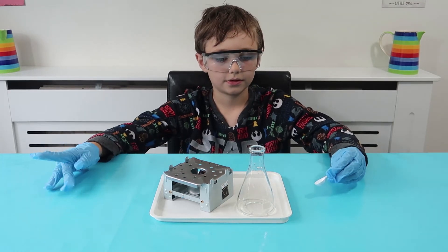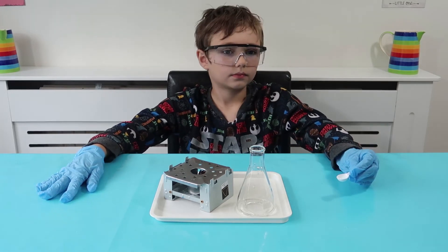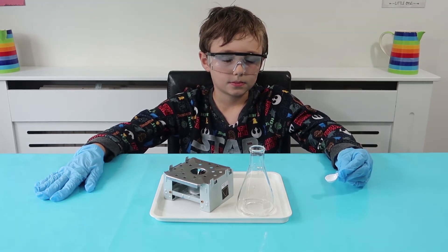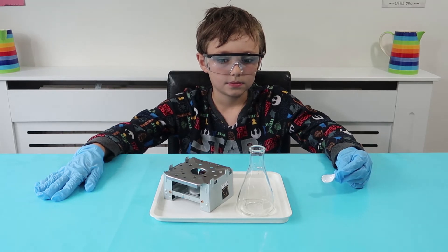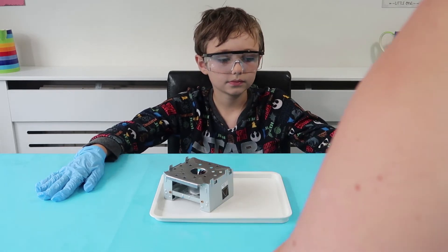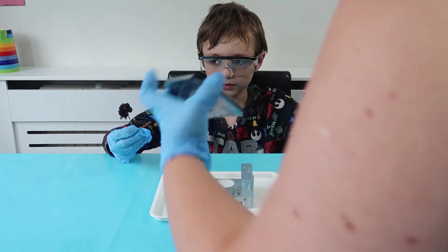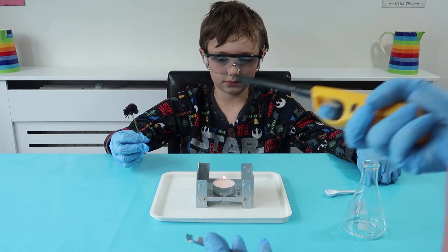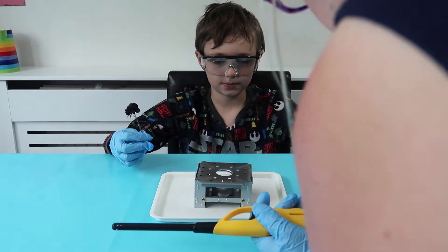The reaction speeds up when heated. Sulfur dioxide dissolves in the water imbued in the flower, forming sulfurous acid. The acid-base indicator reacts to this and changes color. So what we need to do is light that candle — I have got some water here just in case there's any accidents. I'm going to light this candle and pop this back over the top.